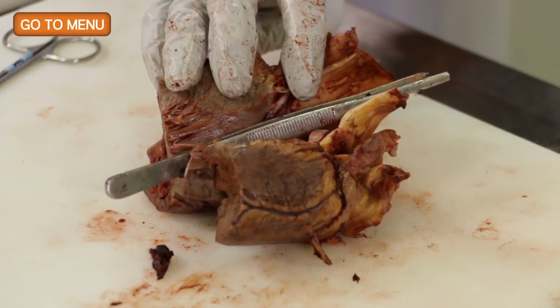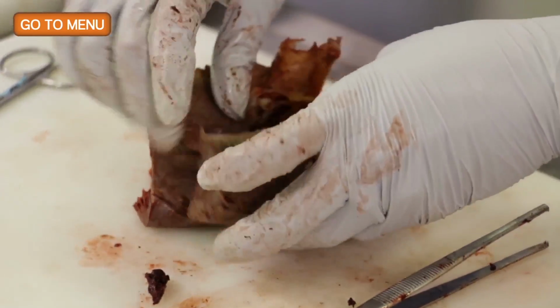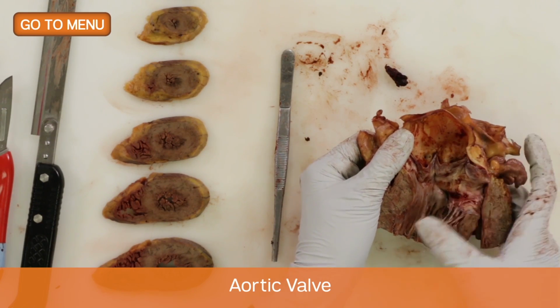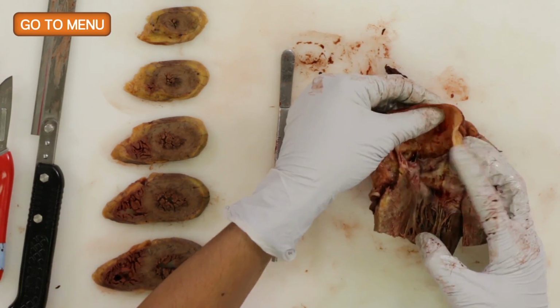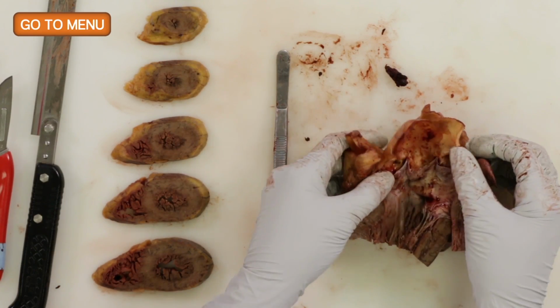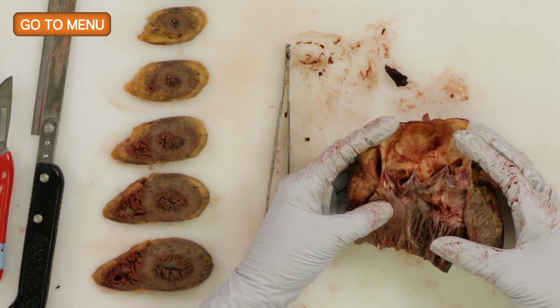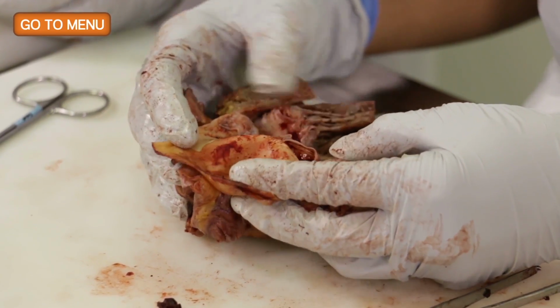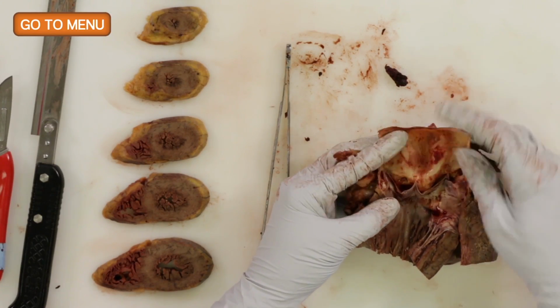So that's the last cut, and we see the aortic valve. In older autopsy, sometimes the aortic valve will have been replaced. There can be significant stenosis. This aortic valve looks, what do you think? Anything abnormal there? I'm going to make sure that the number of cusps are correct. How many cusps? There's 3 cusps.